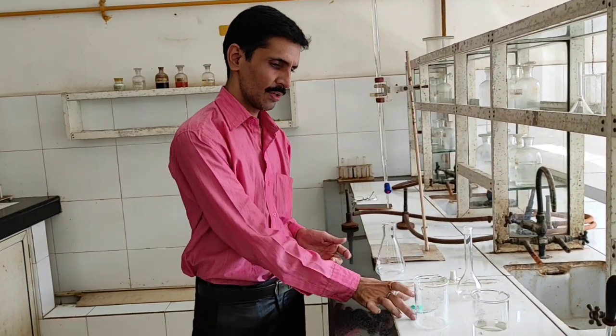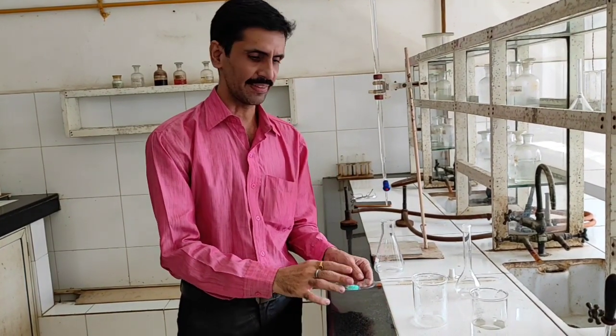So my dear friends, you have understood the theoretical part about how exactly the execution is being done. Now I am going to practically demonstrate the quantitative part. I hope you remember what I am talking about: quantitative is, yes, about the major cation. Alright, so here we have a mixture, which has to be made how much?